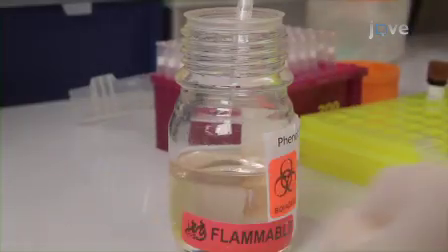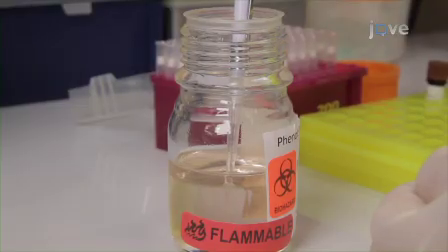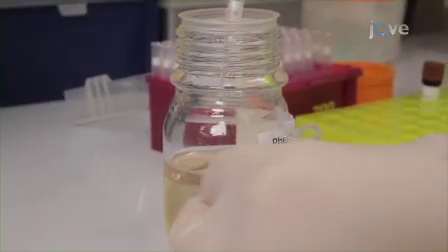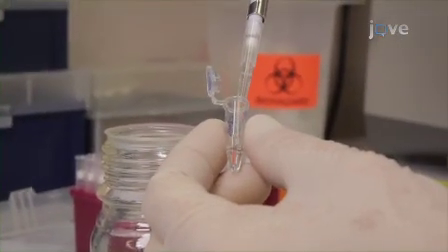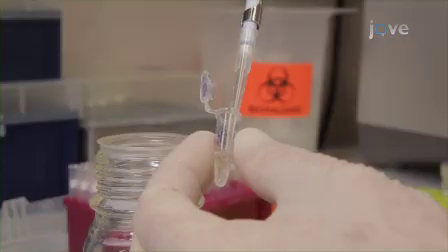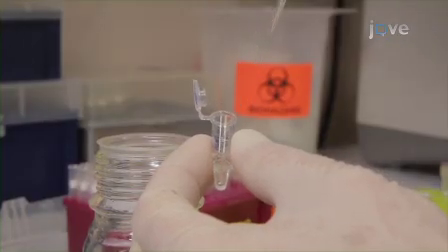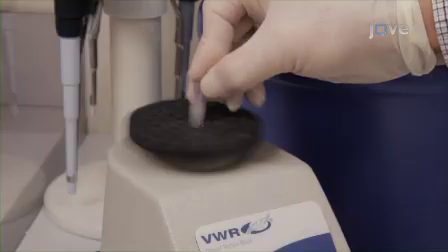To precipitate cDNA, pipette 162 microliters of the bottom layer of a pH 8.0 tris-buffered phenol chloroform isoamyl alcohol, or PCI, mixture, and add to the 162 microliter contents of the second-strand cDNA synthesis reaction tube. Equal volumes of aqueous and organic mixtures are required for this step. Vortex for 5 seconds to mix the contents.